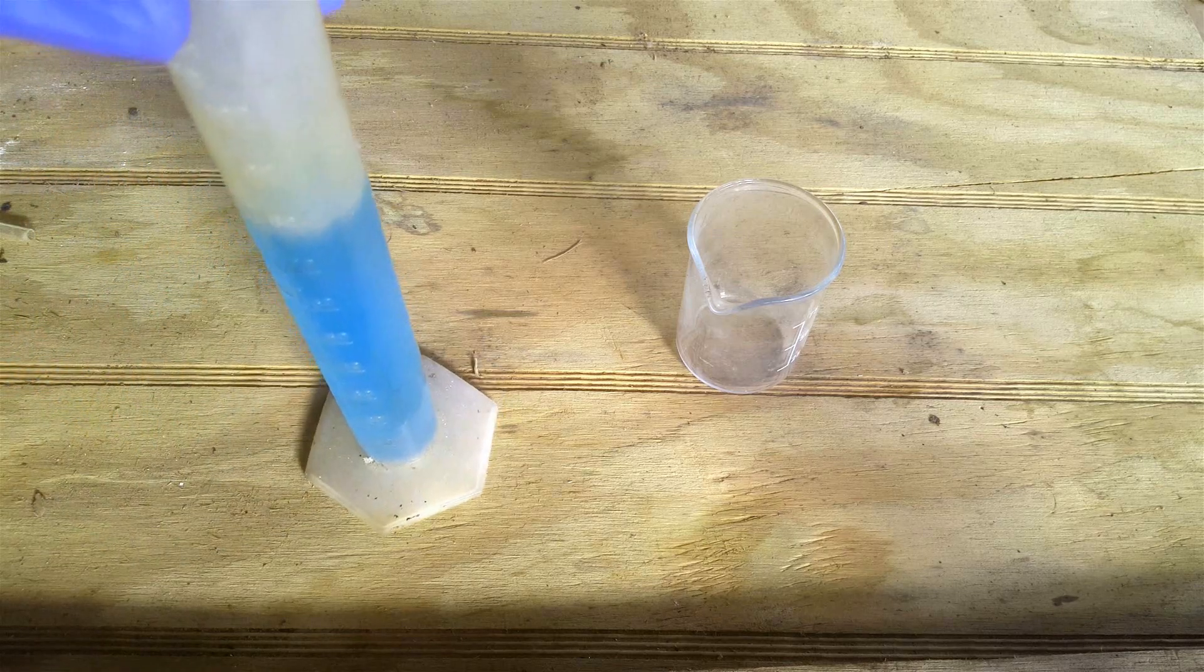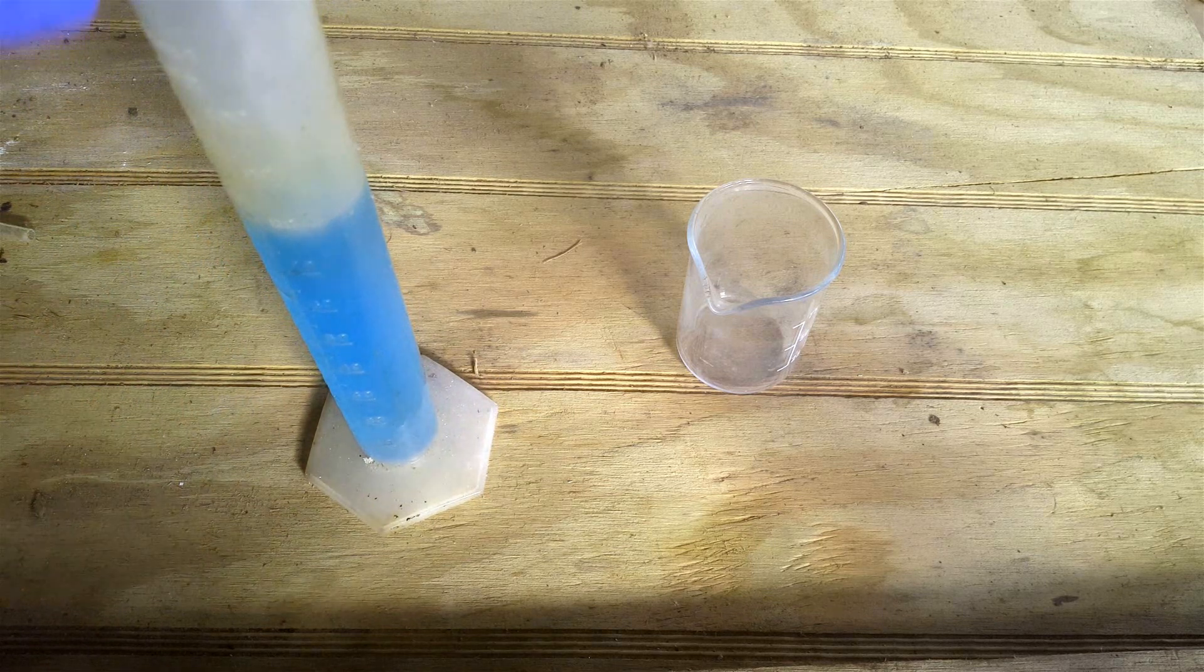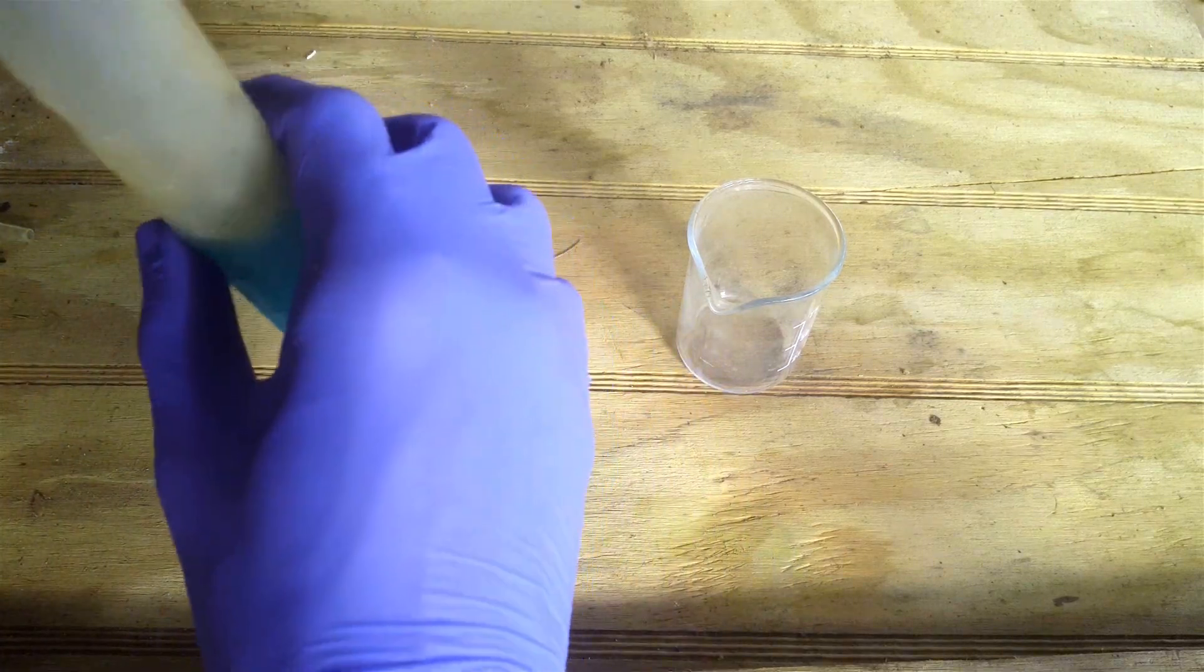Let's start this experiment by adding a saturated solution of copper sulfate in a beaker and conical flask.